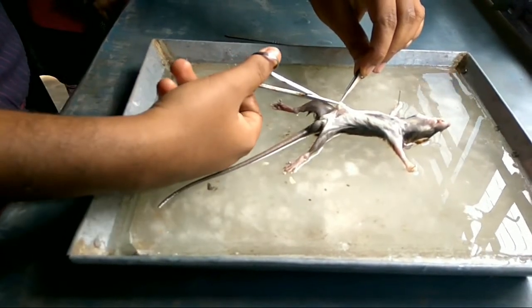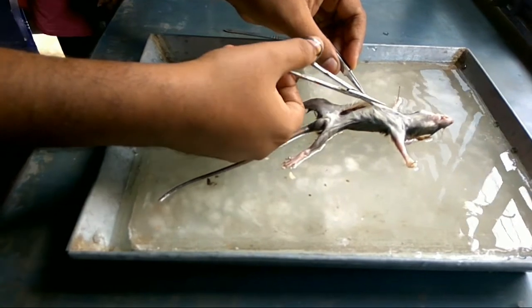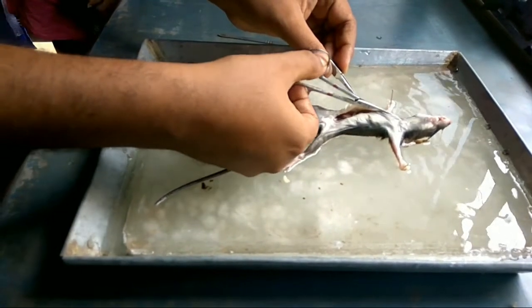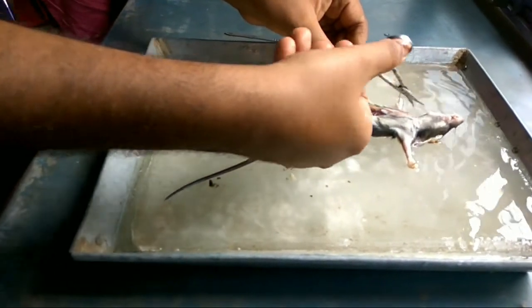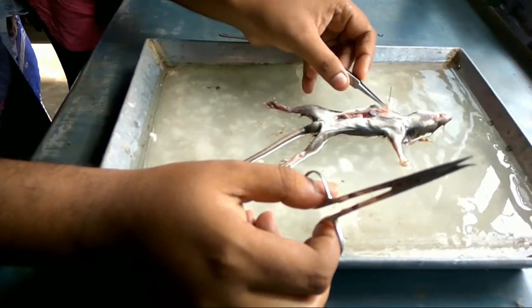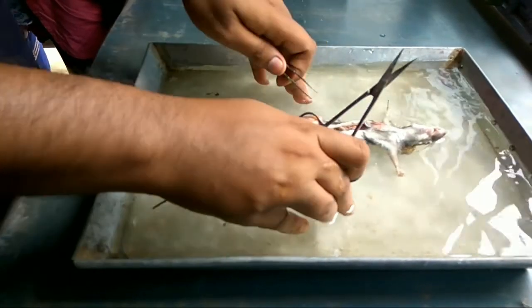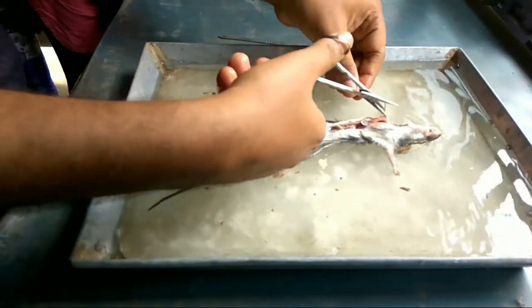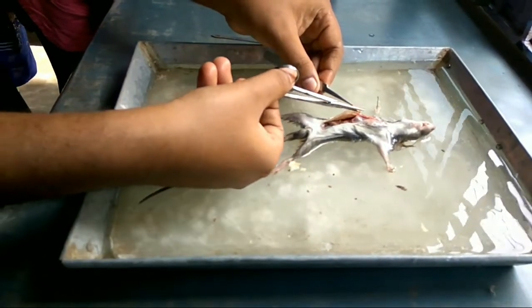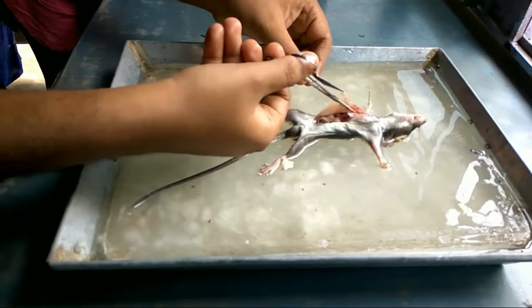Progress anteriorly; in this process you have to cut the ribs. You have to be very careful not to damage the heart. These are the ribs and this is the sternum. Now I'm cutting the diaphragm, and now I'm cutting the ribs.